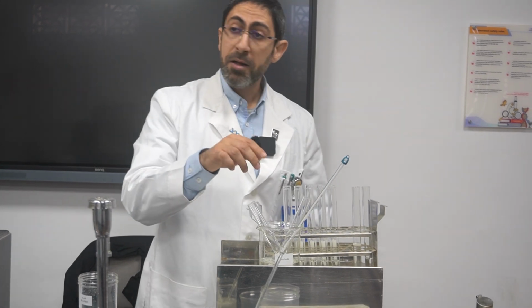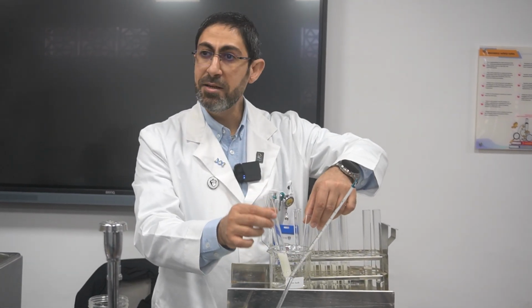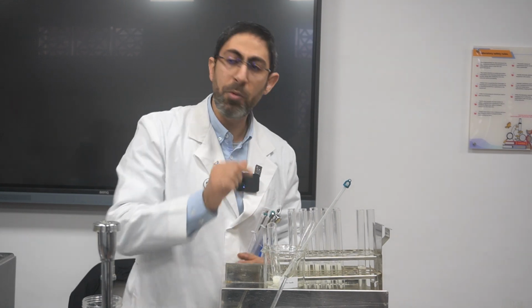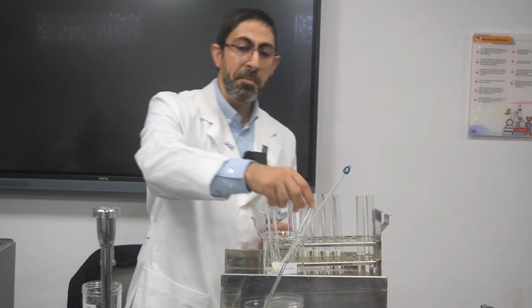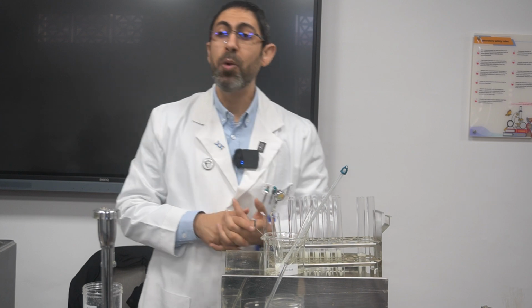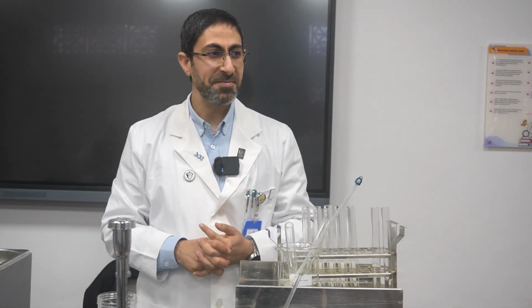Then I will mix the casein with the enzyme and the buffer, and I will give them about 20 minutes in the water bath. During those 20 minutes, I will agitate and mix them thoroughly in order to be sure that they are reacting. Where is the end point? Who can tell me? Where is the end point?